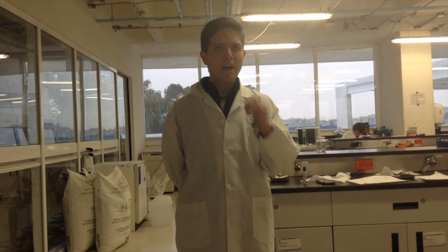It is very important to take into account some rules while making solutions for user safety and to have a correct preparation of them. Now we have different types of solutions ready to be used during the semester, like all the ones enunciated along this video, depending on the particular characteristics of the reactives involved. Specifically, there are two hints when making a solution: adjusting pH before reaching the final volume. There are some tools that can be used to dissolve rapidly: heat, agitation, and inversion.